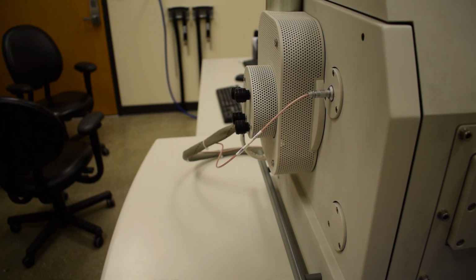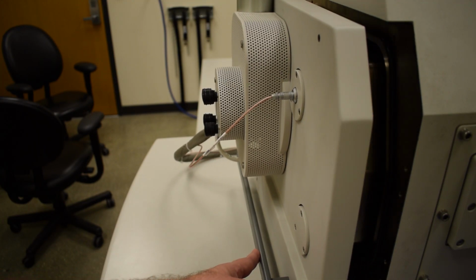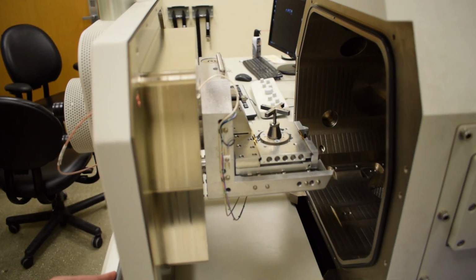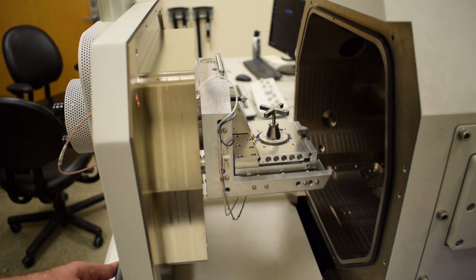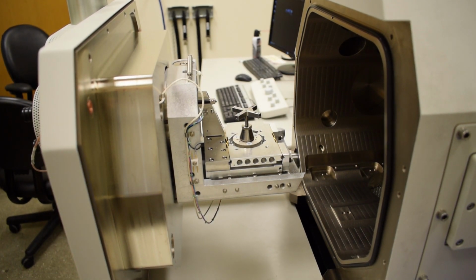When you open the microscope door, it is important that you do not let the door crash against its stop. The door can slowly be opened until the handle approximately reaches the end of the counter. At this point, you will feel the door hit a stop, and you should not pull any more than that. If you pull the door rapidly open and crash against the stop, it can actually shake components loose on the microscope stage, which could cause service issues for the system.